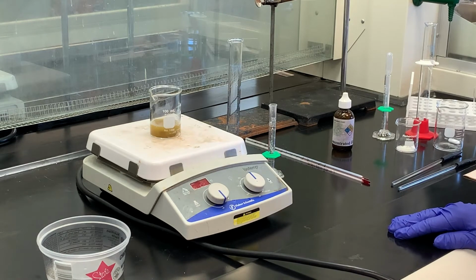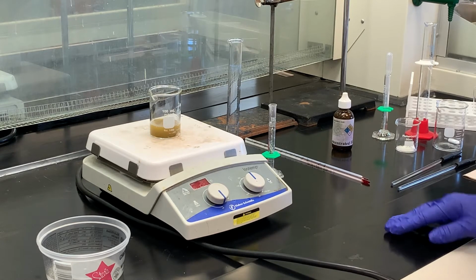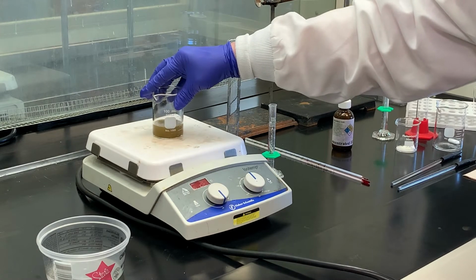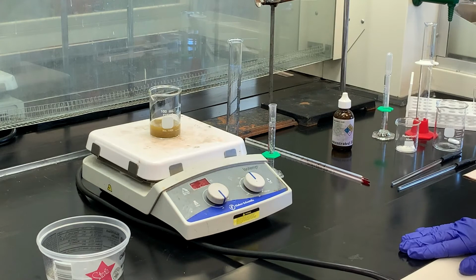Para-nitroaniline is one of those substances, even though it has the NH2 group, that nitro group really limits its solubility. So it may not completely solubilize. It typically will as we add the sodium nitrite solution to it, but we'll try to get as most of that in solution as we can. So I'm going to let that stir for a few minutes and then we'll come back and take a look at that.